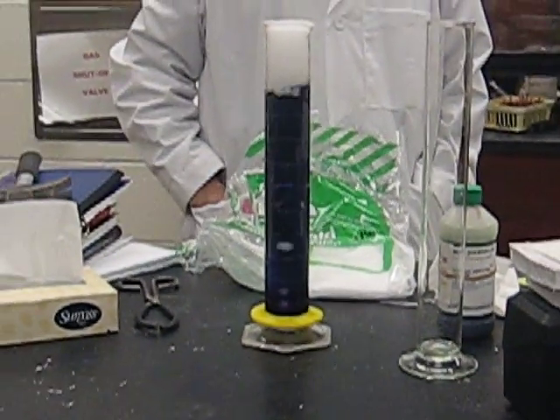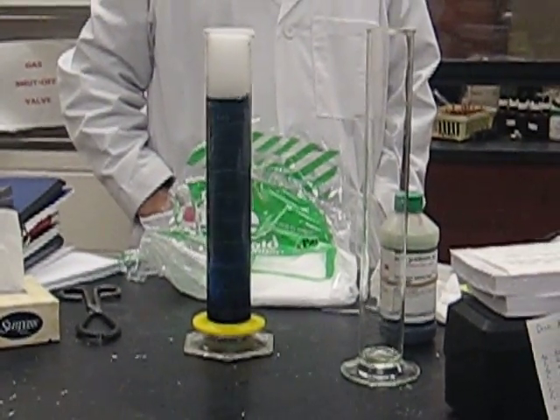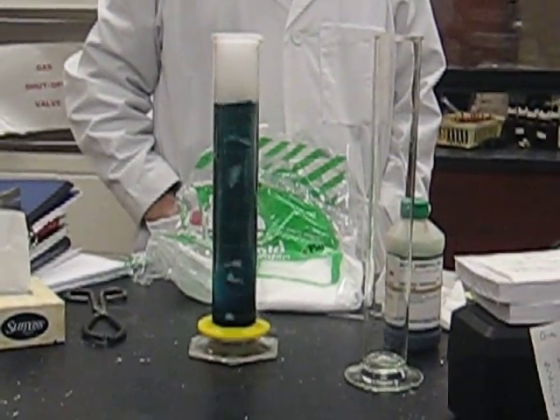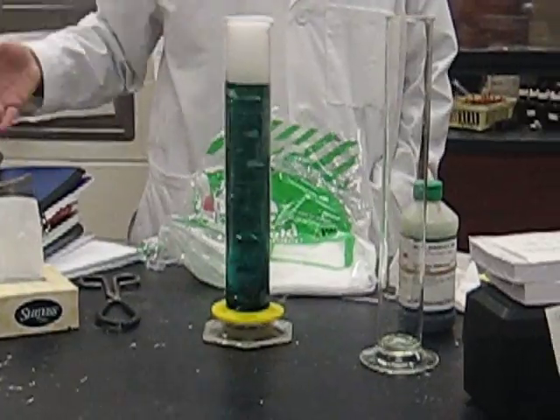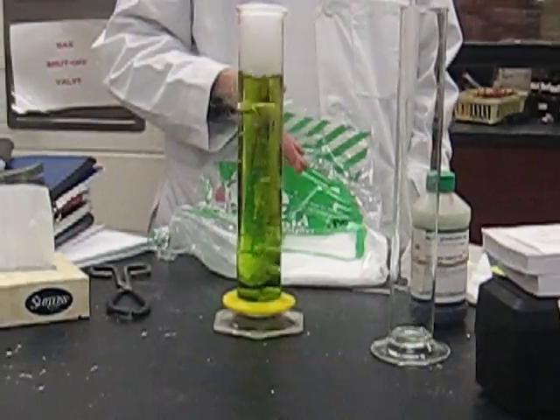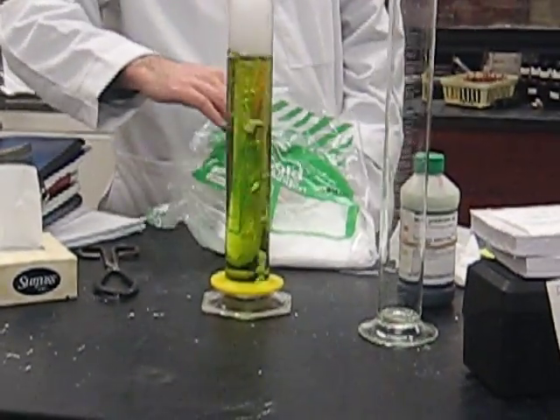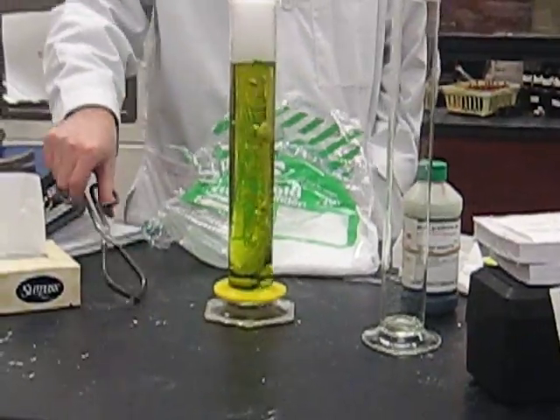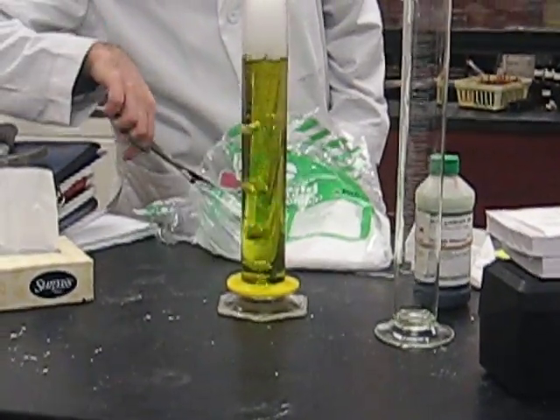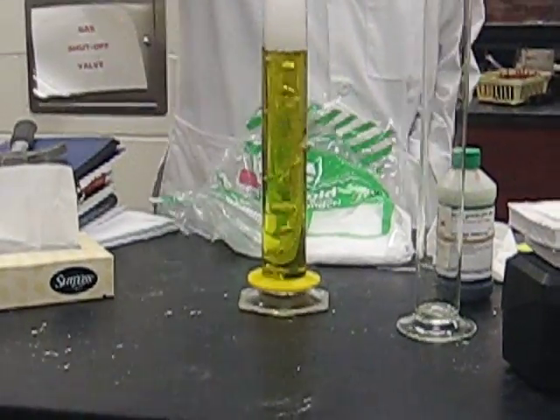Back to green? No — even back to red. Blue right now. From purple into a blue or a teal, back to green, into yellow — and now we're into the acid range. And if I drop in a large piece, we can force it way into the acid range.